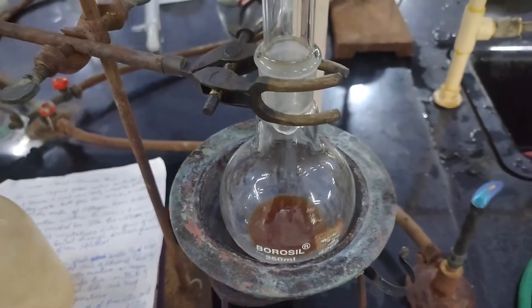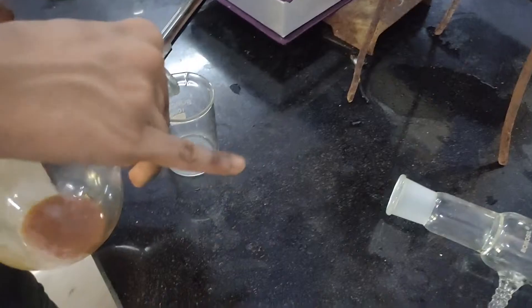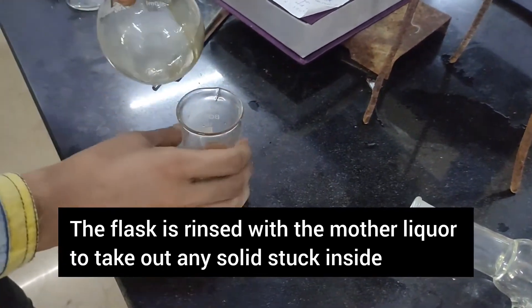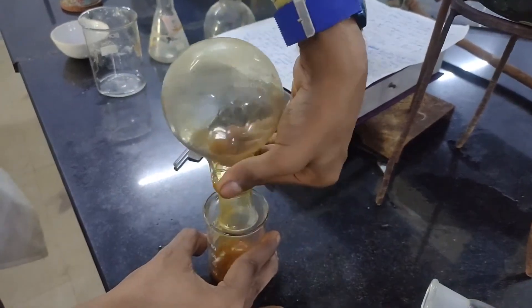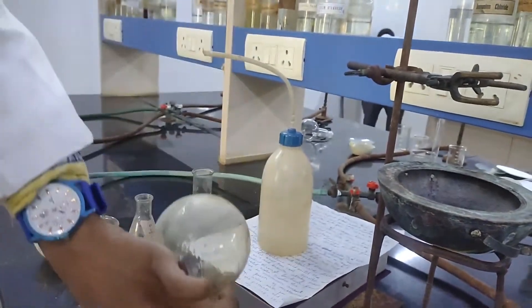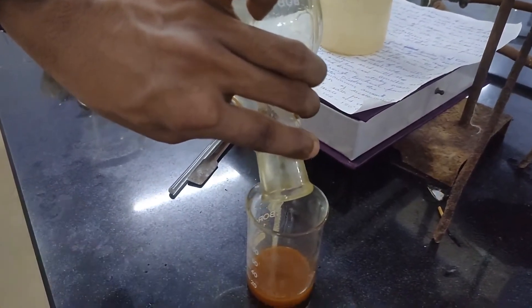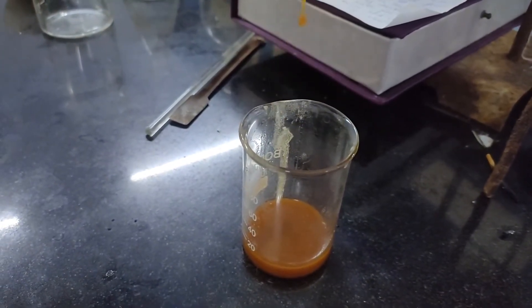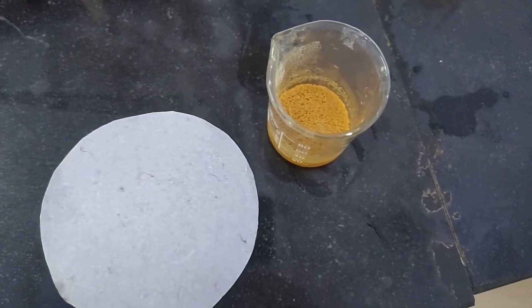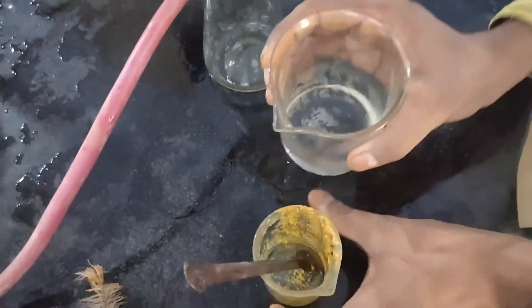After 30 minutes, the flame was removed and the flask was taken out. The warm contents were poured into a small beaker. There was some residue stuck inside the flask, so it was washed with the mother liquor to transfer all the residue into the beaker. The flask was then emptied. On standing, the potassium salt of benzilic acid separates out.